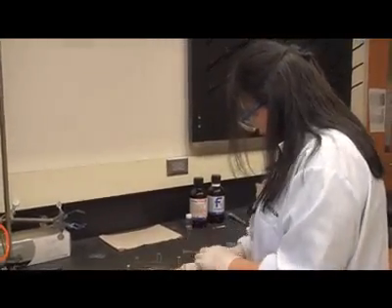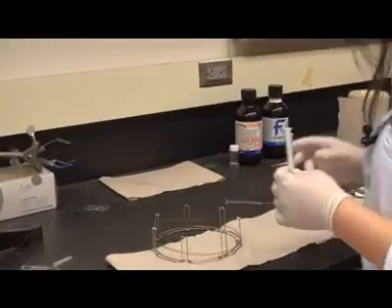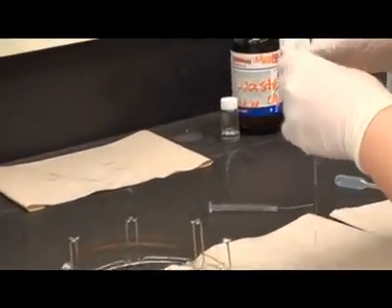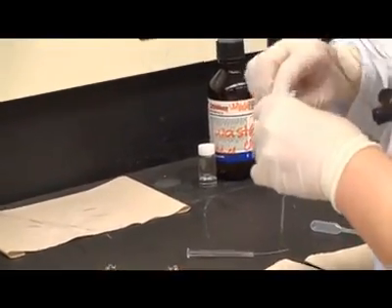This kind of goes in an in and out pattern. Now we can take our coating solution and put it into the syringe.